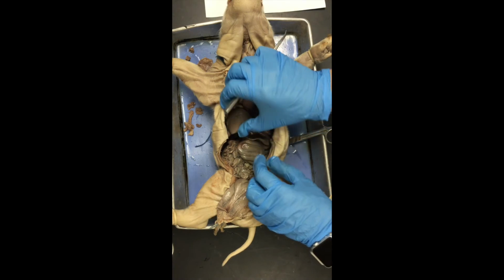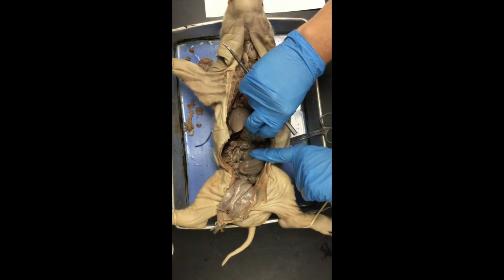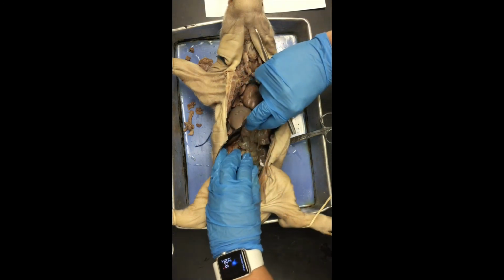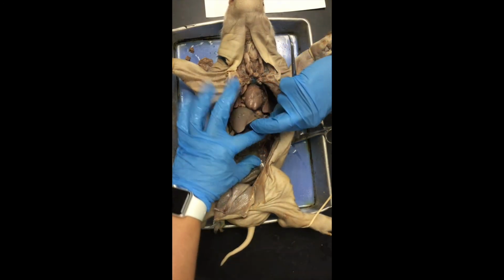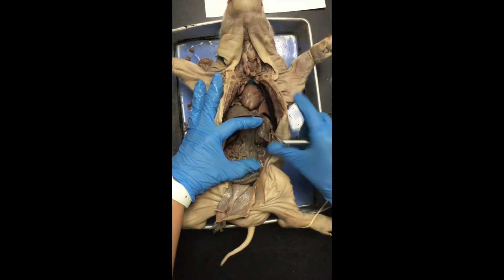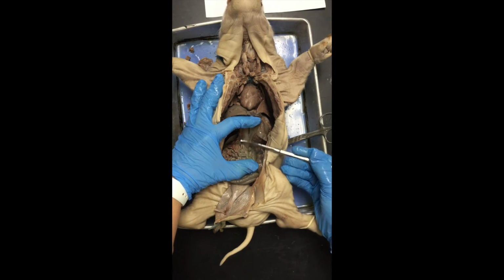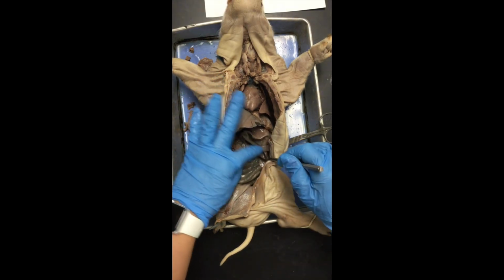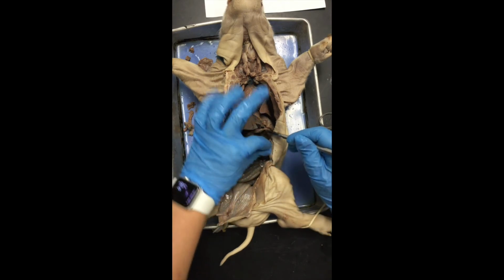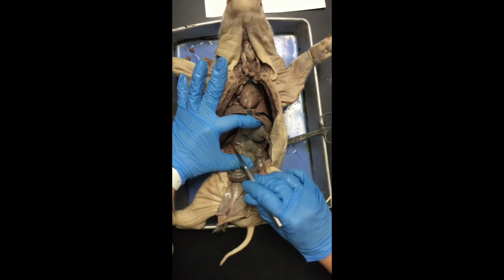If we lift up the liver and the stomach to kind of view and kind of push down the intestines, the pancreas will come into view. So hopefully maybe you can see this. It may be a little dark, but there's some more of that peritoneum right here. Right, so we're just going to kind of peel through this peritoneum, almost like a little spider web that's there. Lift the stomach up, and we're able to see the pancreas.